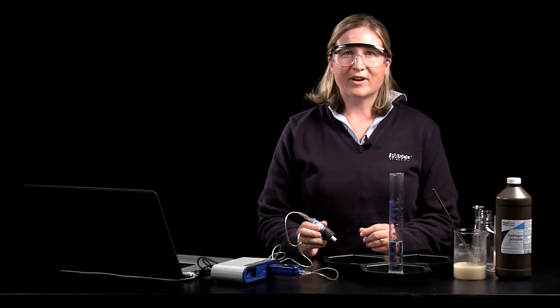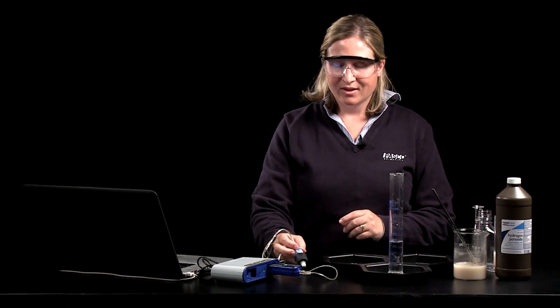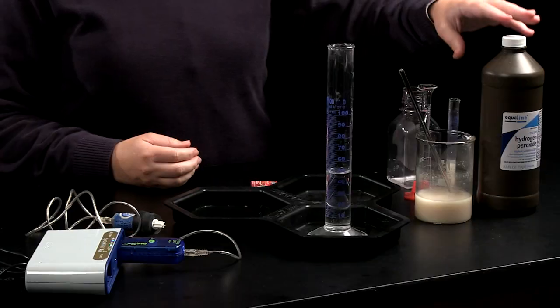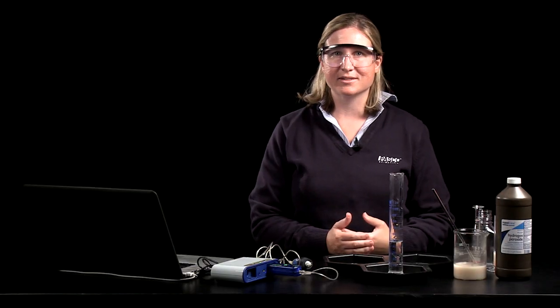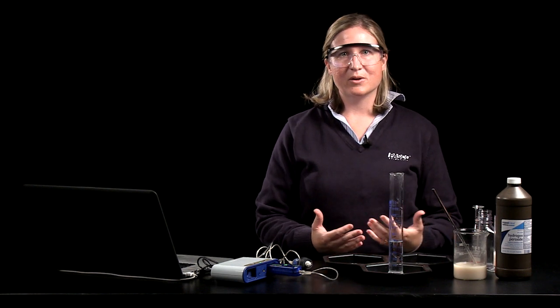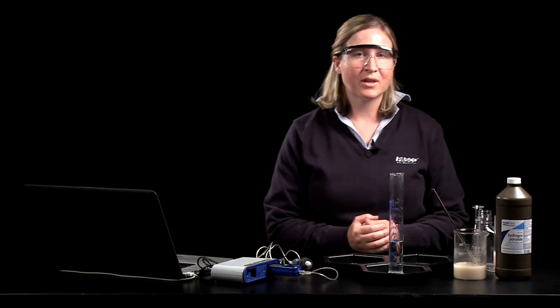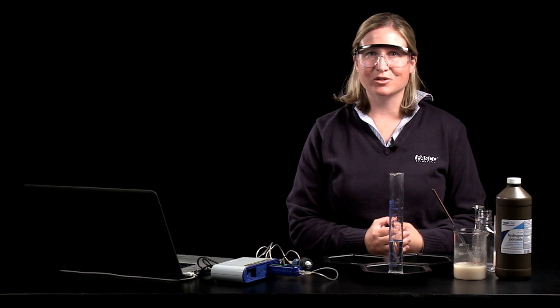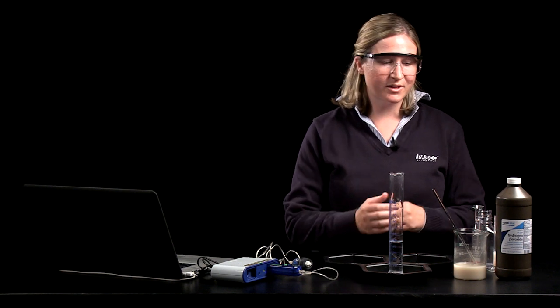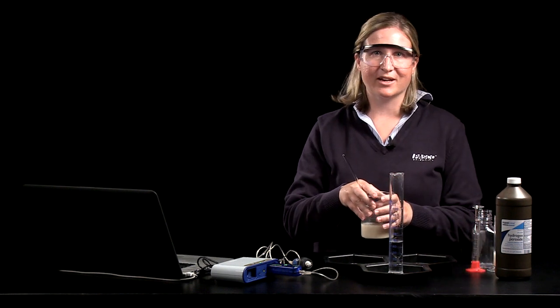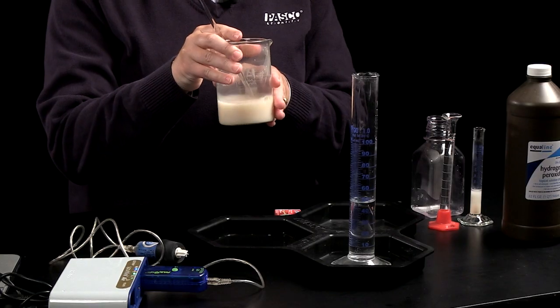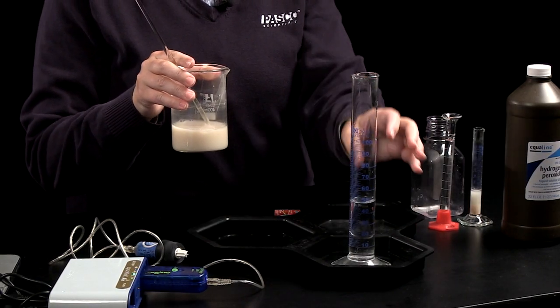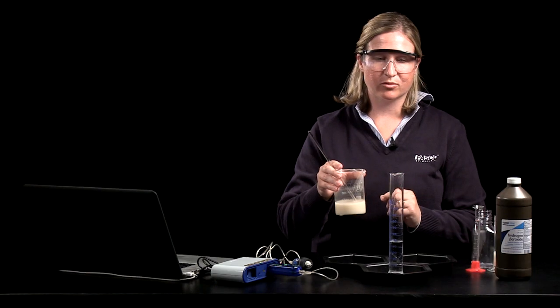In this final segment we'll look at a demonstration involving the oxygen sensor. This demonstration involves the breakdown of hydrogen peroxide catalyzed by catalase, an enzyme found in yeast and many other organisms. You can use yeast or potato or liver as your source of catalase. Yeast is an easy one to obtain so that's what I'll be using today. Before having your students use the oxygen sensor to measure variables such as temperature or pH and their effect on enzymes you might start off with a demonstration that helps them understand why they're using the oxygen sensor. So I'm going to take a suspension of yeast and water and add it to a graduated cylinder to which I've already added about 40 to 50 milliliters of hydrogen peroxide.